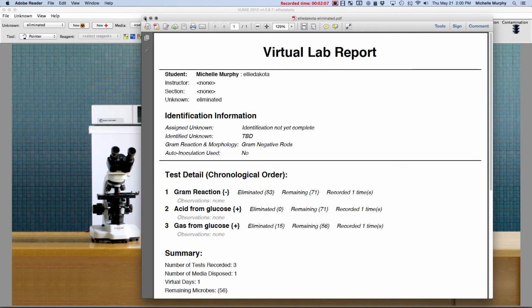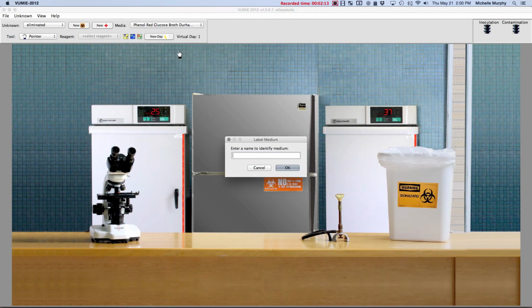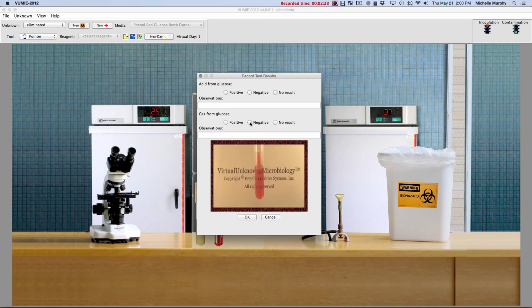What would happen? Let's try it. And you can do the test as many times as you want. Each time you do it, it'll override the test before. So glucose 2 will override glucose 1. I put positive last time, let's put negative. Okay, I'm going to put negative.